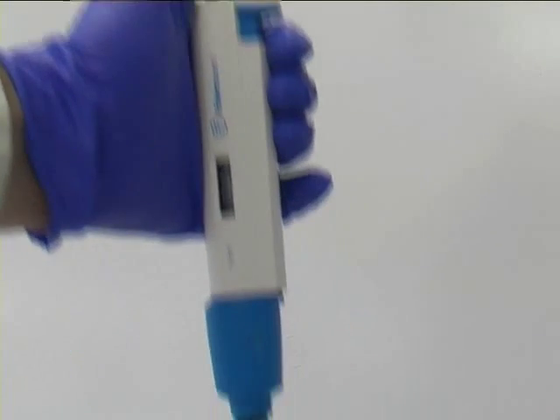When filling the pipette you push down to the first stop only and then release the button to fill the pipette.